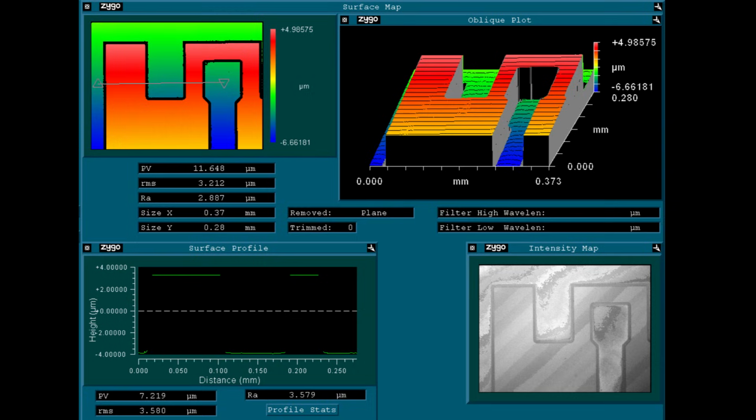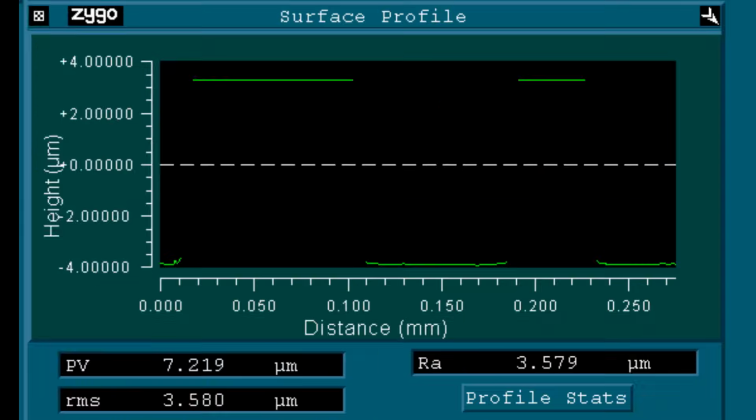Here you see what the coherence scan looks like. First we observe the interference scanning over the bottom of the channels, then sometime later we observe them over the rest of the surface, and the separation in time is because the channels have steep walls and are multiple microns deep. If you look at the measurement data, they show that these are actually 7.2 microns deep.